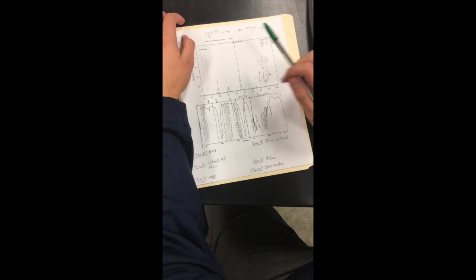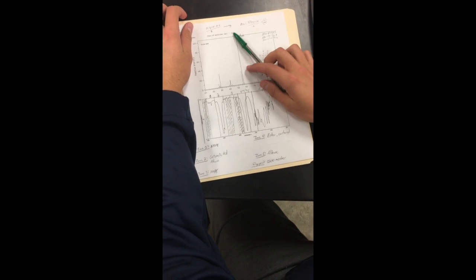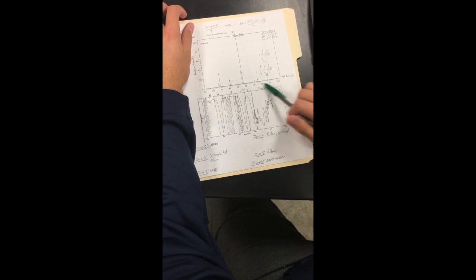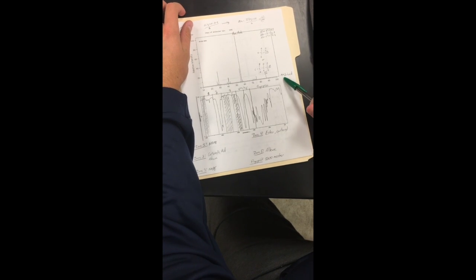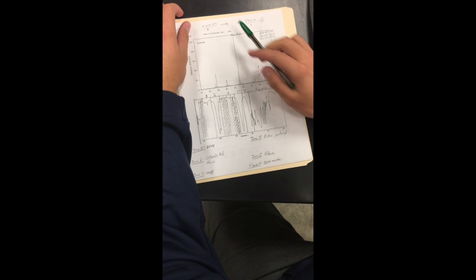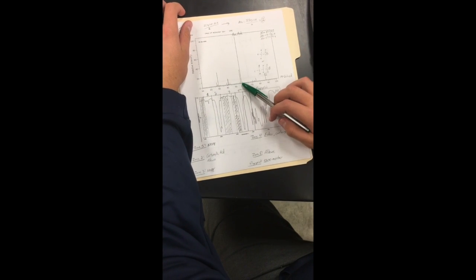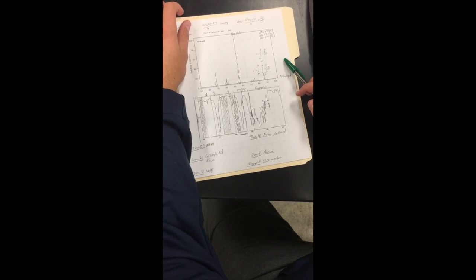of C7H14O2. Alright, so first we're going to look into the mass spec here. We looked at the mass, which was 130. We see that the graph length was 100. So the M+ was destroyed, which was fragmentized. So we will take our measurements from 130. So the base peak was found to be about 57, and we did the math.